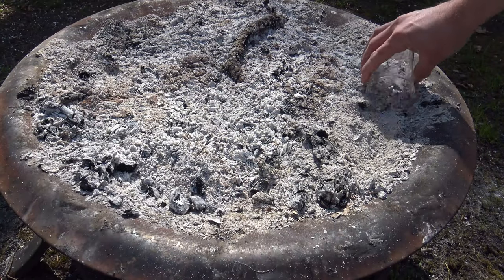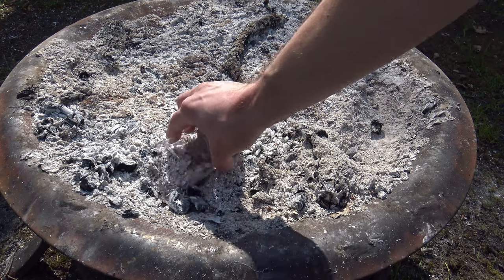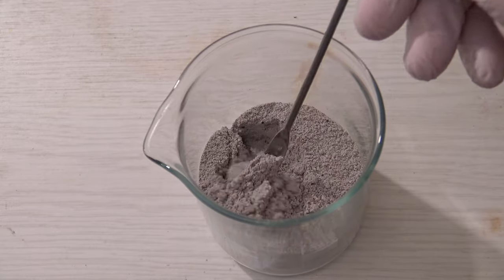When organic material is burned, usually a part of it is left behind as ash. It consists of a variety of salts and inorganic compounds. After putting it through a sieve, it can be used very well for experimenting.